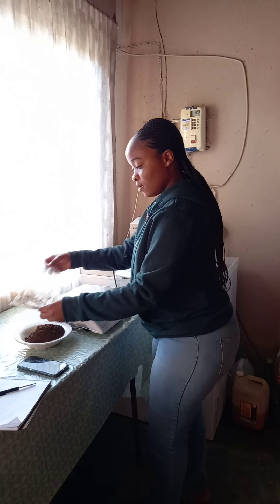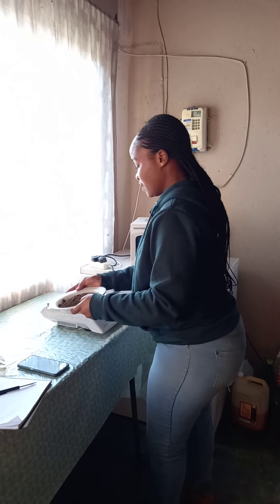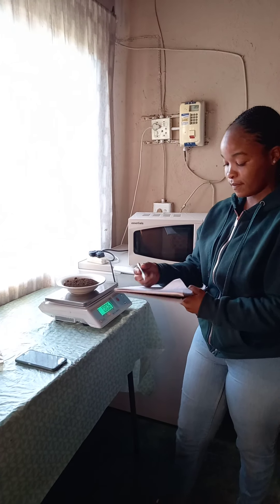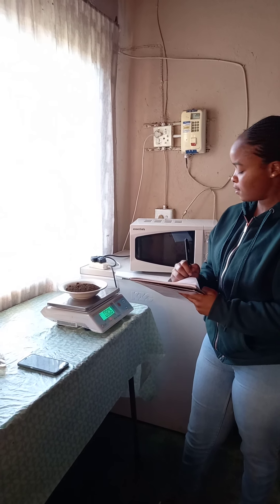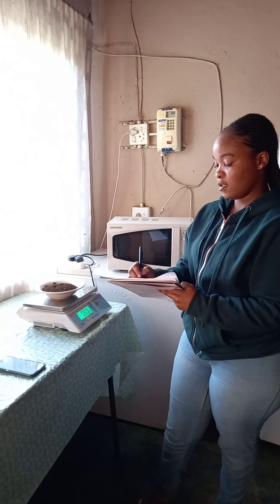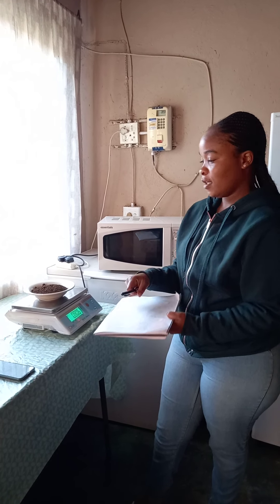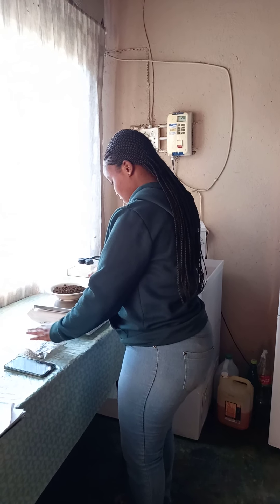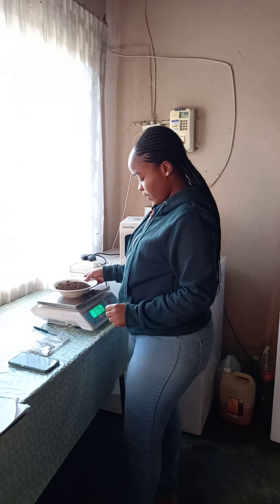After that, we weigh our soil sample in the bowl, which will be 0.086 kg, and multiply it by 1,000. But before I make a mistake, I have to weigh my bowl first so that I can see how much it weighs.